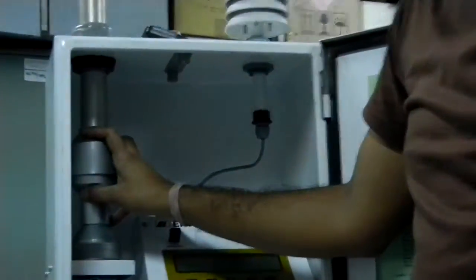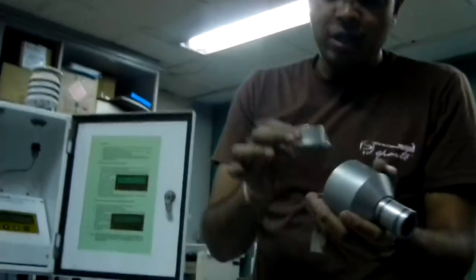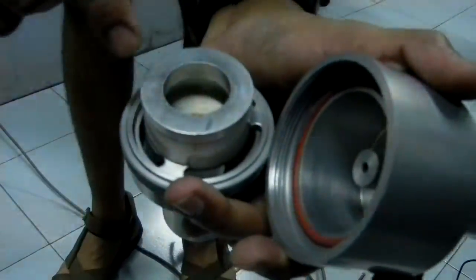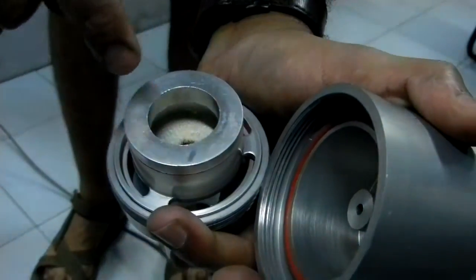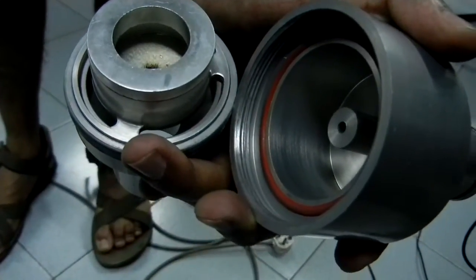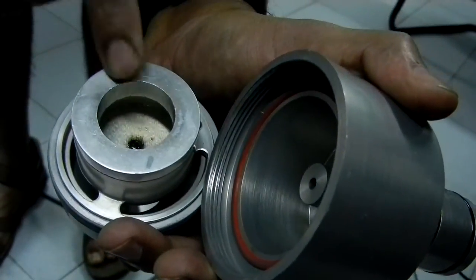There is a tubing system and we have a PM2.5 impactor in this. The coarser particles will go further into the PM2.5 impactor. This impactor has an impaction plate, as you can see. We have to put a 37mm glass fiber filter into this and fill it with silicone oil. The particles visible there are coarser particles greater than 2.5 microns, which have been collected on the filter paper.